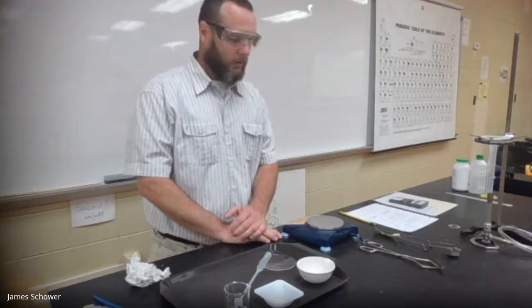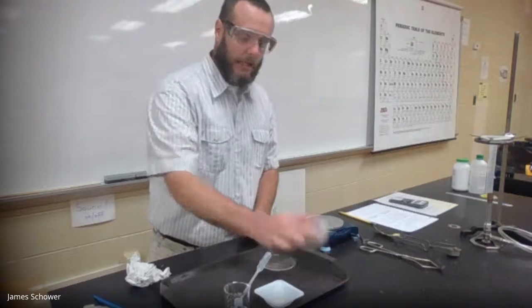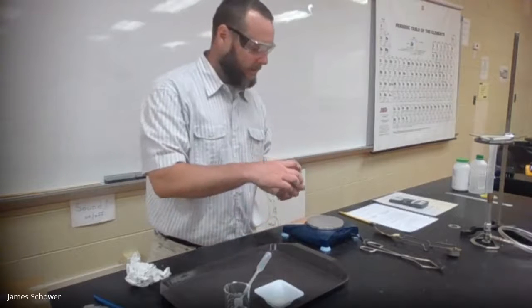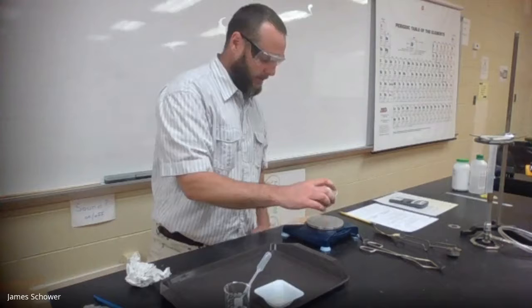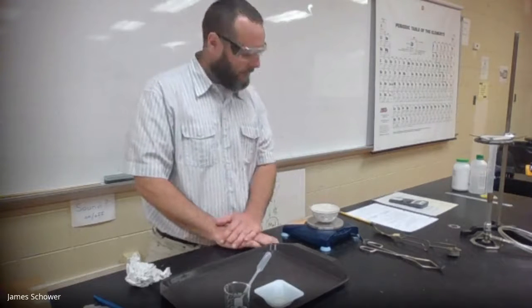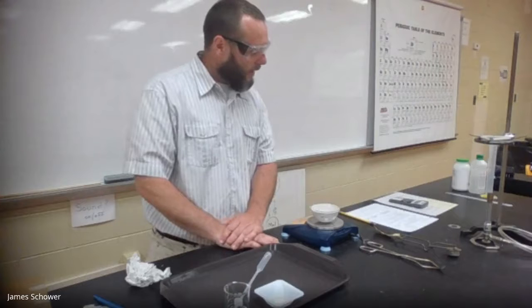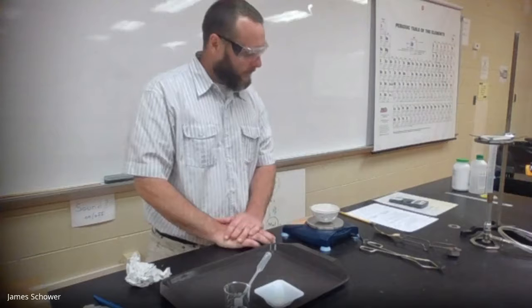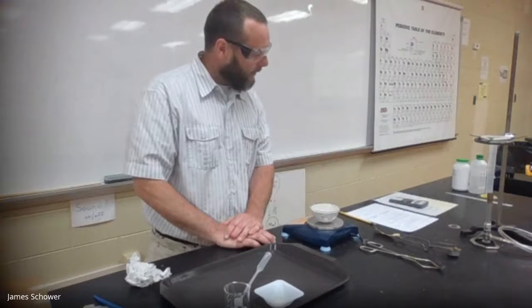We're going to begin by weighing a clean, dry evaporating dish and watch glass. Zero out the balance. We're going to put that on there, and I'm going to do the first couple steps for you. All right, so we get 105.49 grams for the two. That goes in data table number 1.